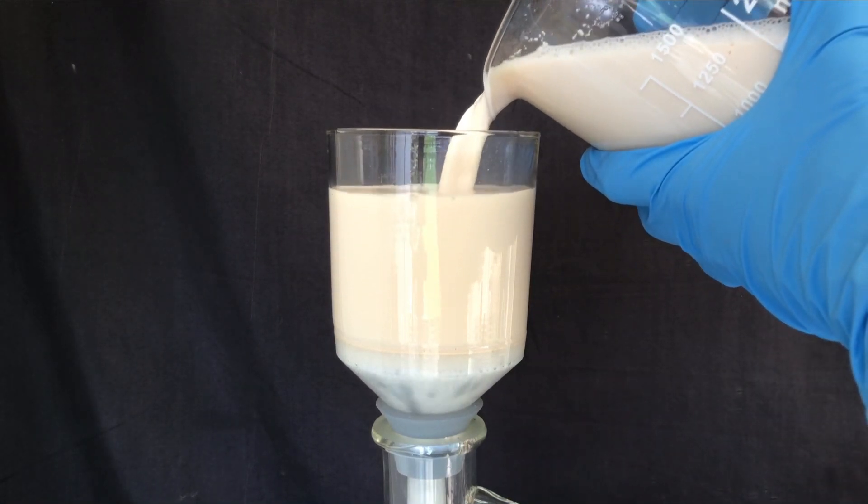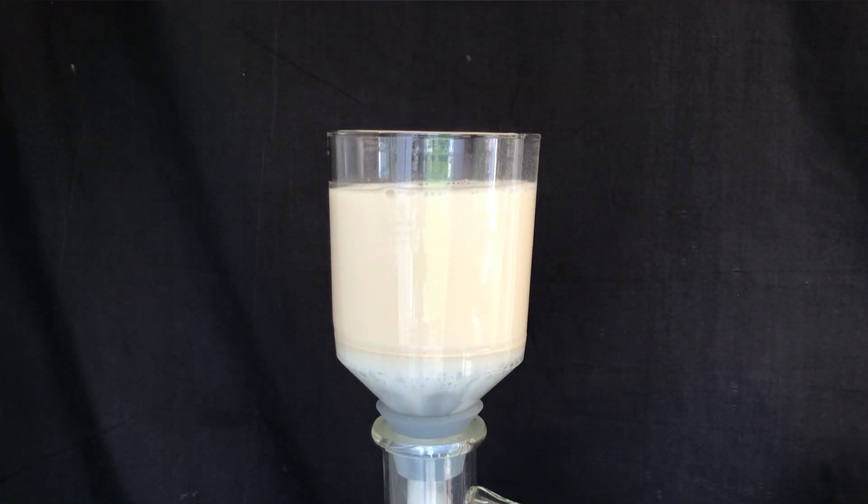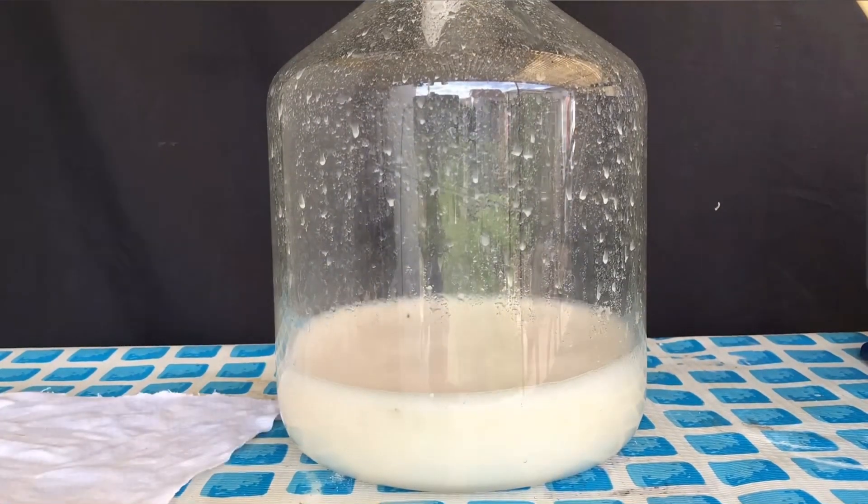A lot of calcium peroxide is really fine and made it through the filter. I'm doing this as a proof of concept anyways, and as long as we get little product, I'll be happy. It took about an hour to filter most of the solution.